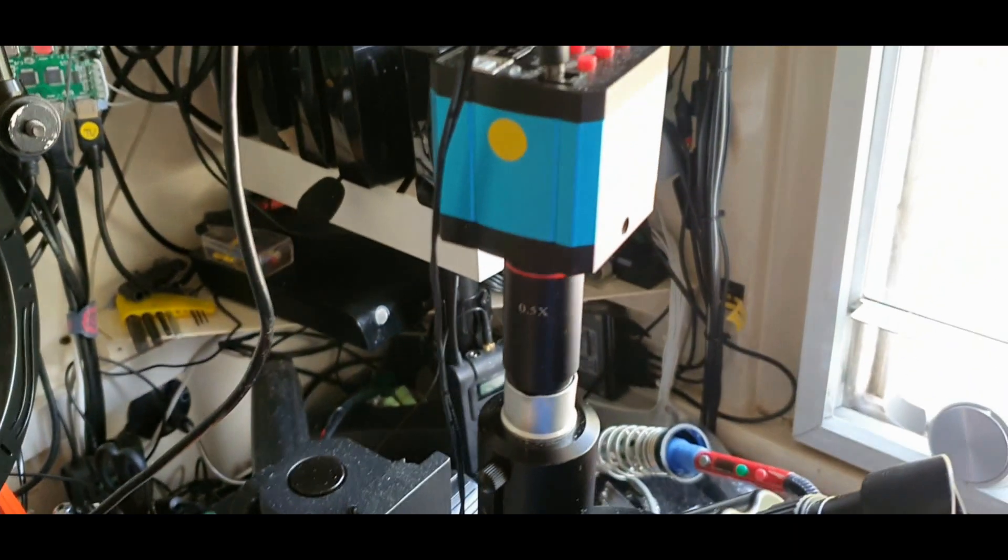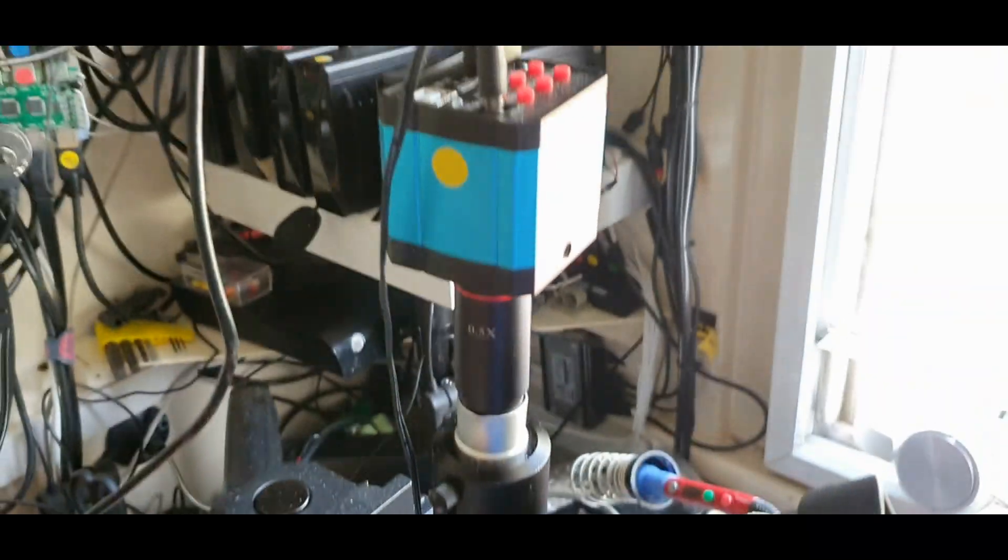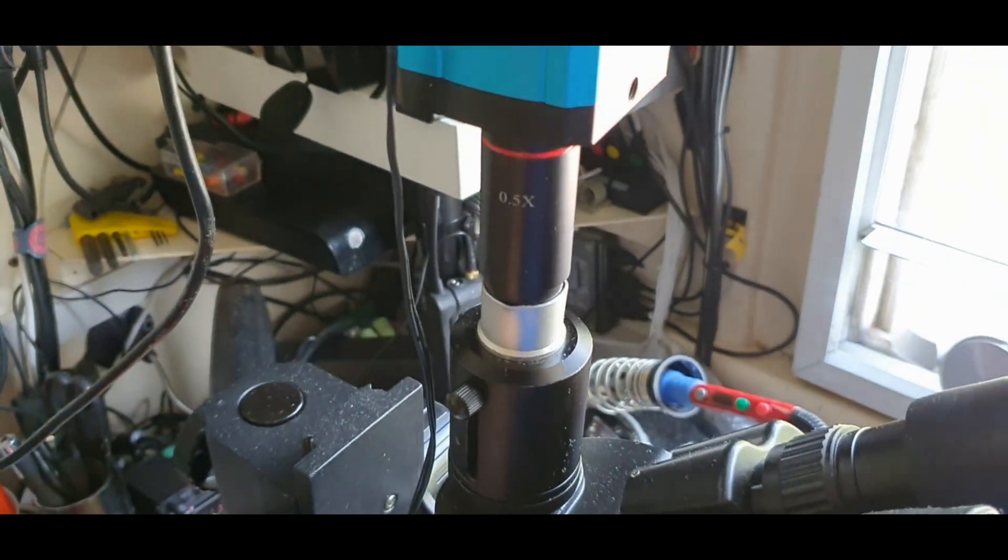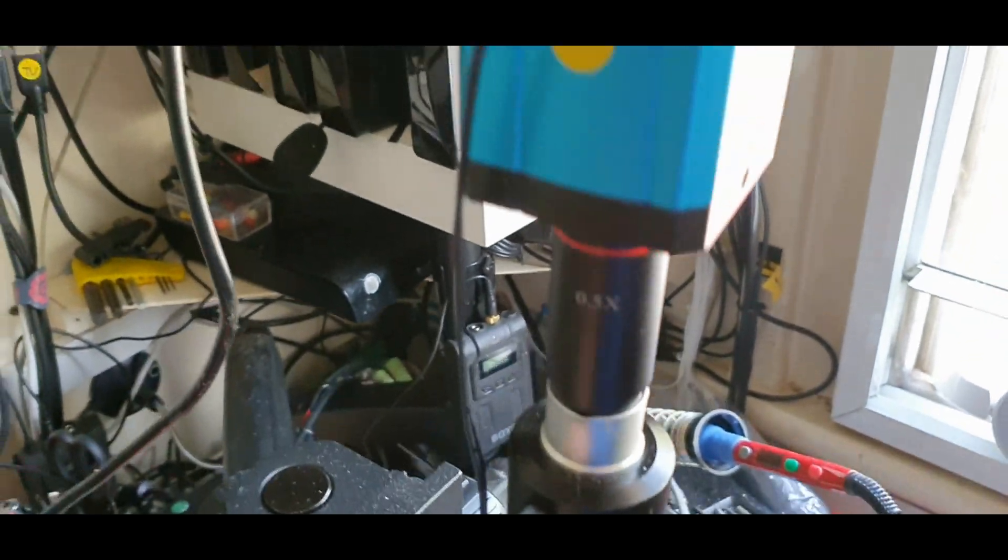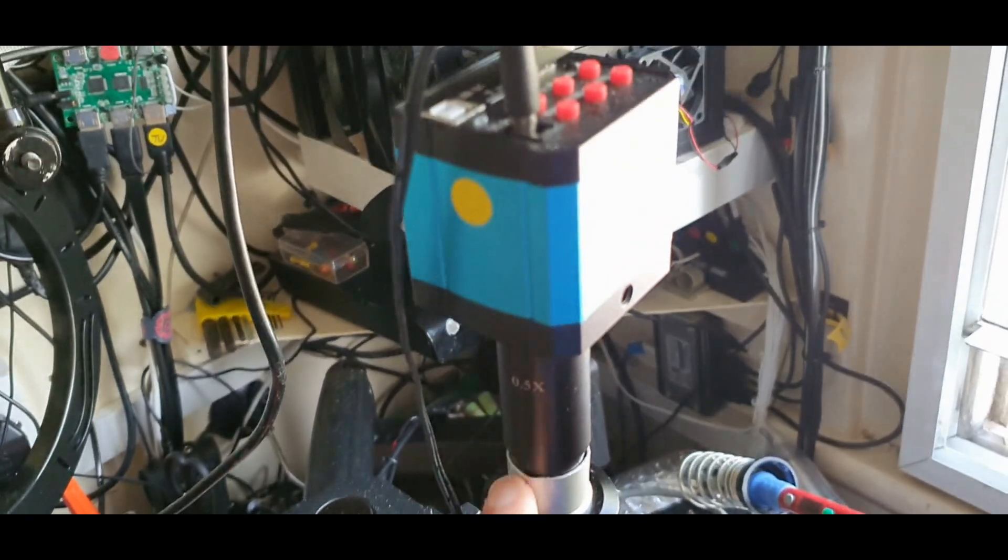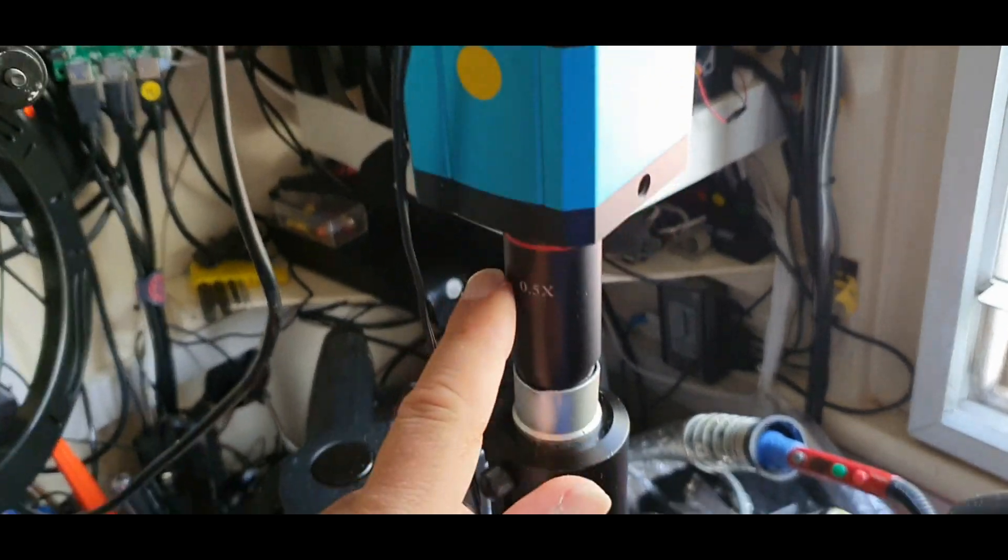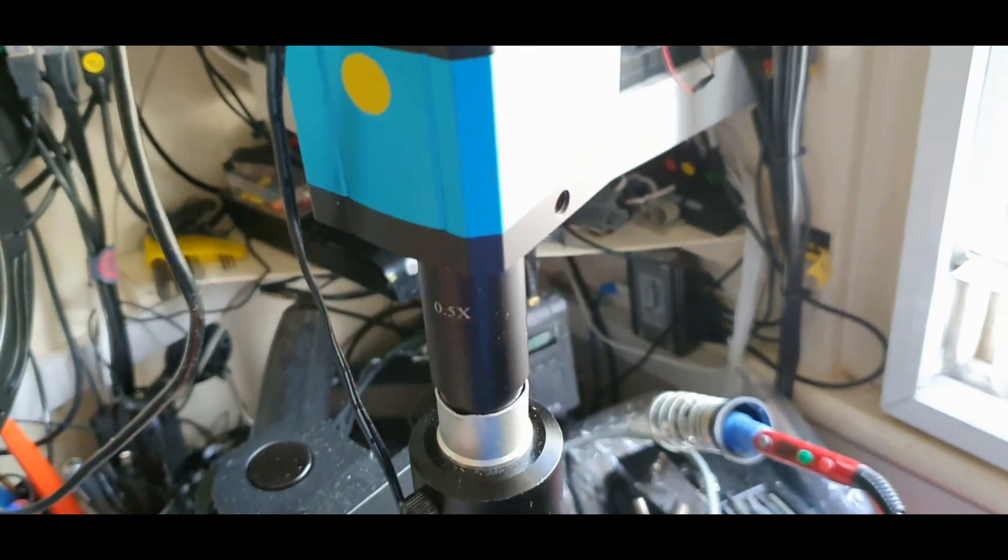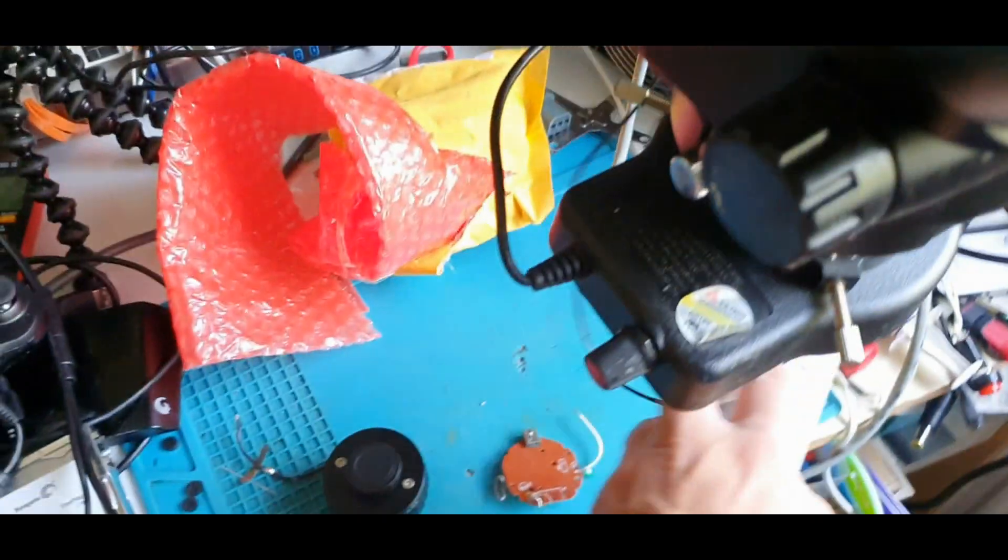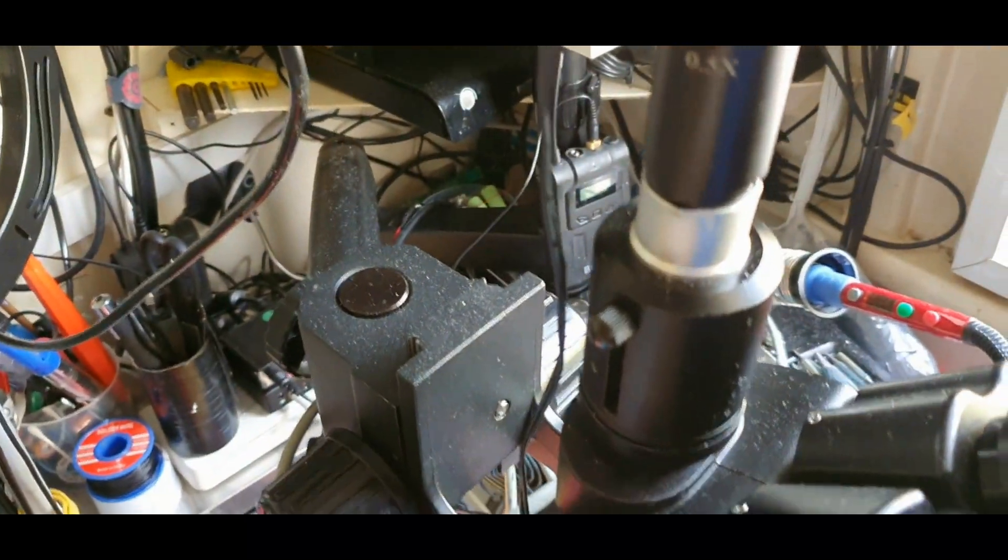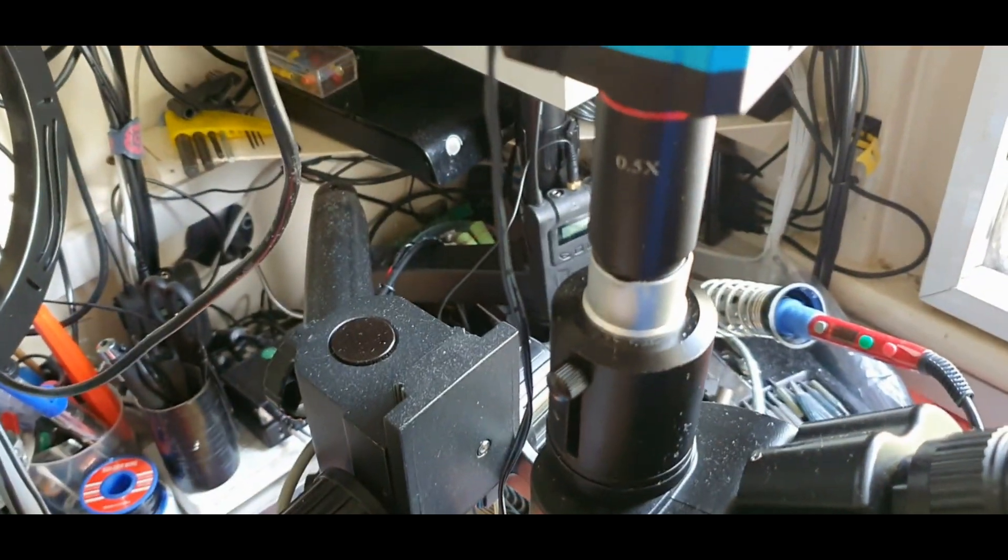So we're going to change this. This comes with the camera when I bought it in the box. This didn't. So we're just going to replace it. Then try with this first and see the difference.